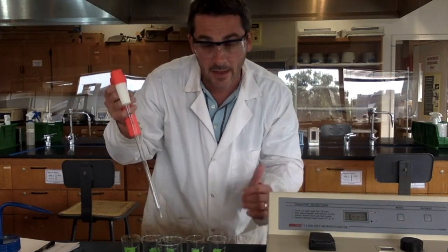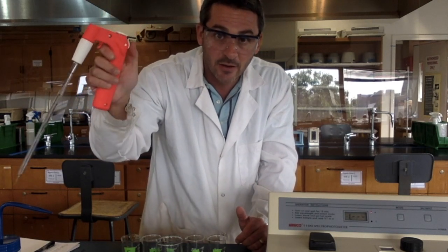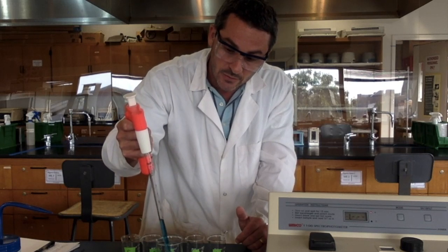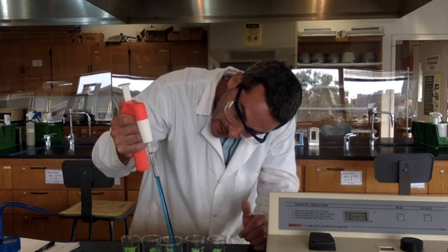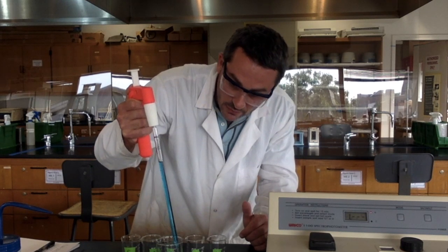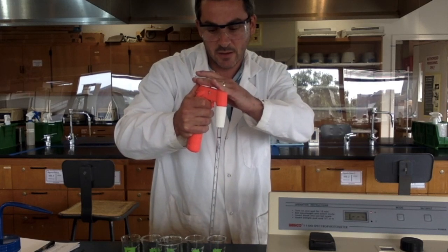Regardless, I'm using 10. So I take my pipette with my pipette filler, and there's a dial on the back here. I'm going to roll that dial, and that will suck the liquid up into the pipette. You can go a little bit past where you want, and then roll your thumb back down a little bit and get that meniscus right on the 10 or the 0. And then I put it in my beaker, and I drain out the pipette.